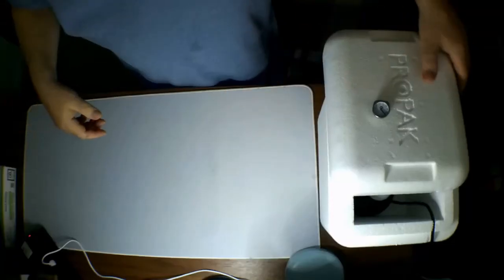Thanks for sticking with me. I know this is a long video, but I felt it was important to go over all the parts and see how everything was being processed, so that it was clear what sort of techniques we were using on this. So let's go ahead and look at the first pair of petri dishes. Now this will be the sock dishes. Alright, let's go ahead and pull them out.